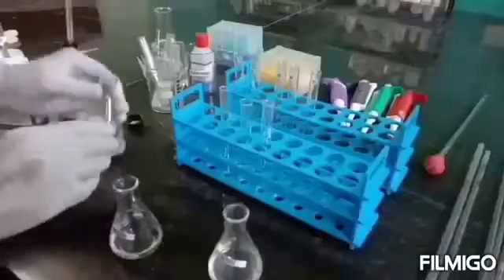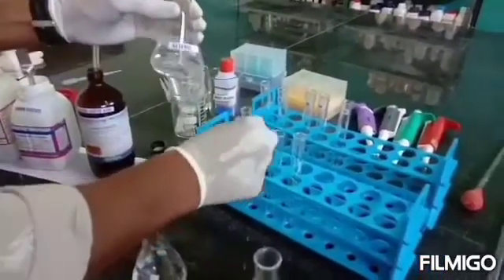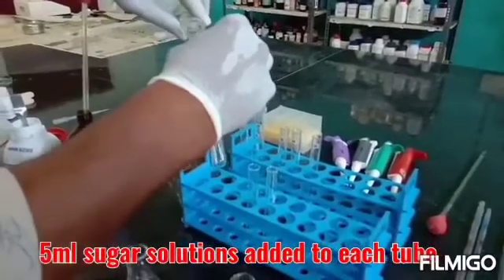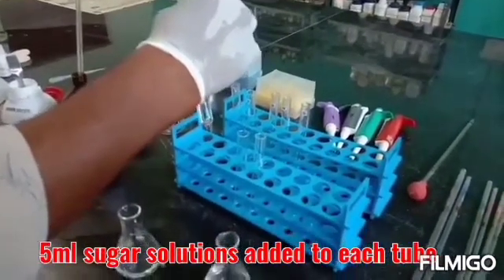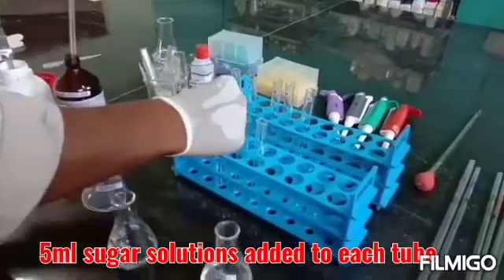First of all, we add approximately 5 ml of 2% glucose solution to the first test tube, followed by addition of maltose and lactose to the other test tubes.